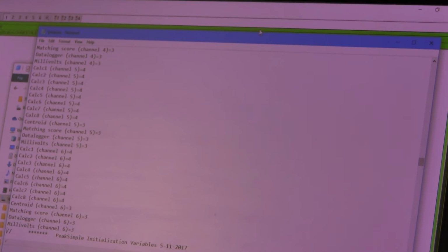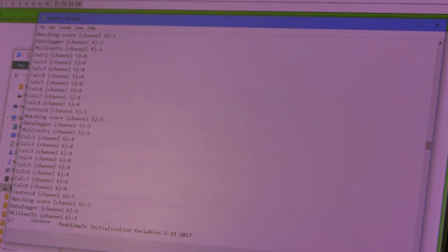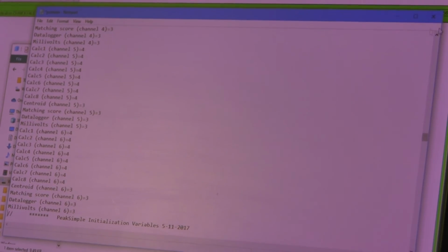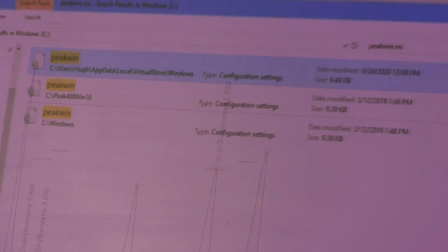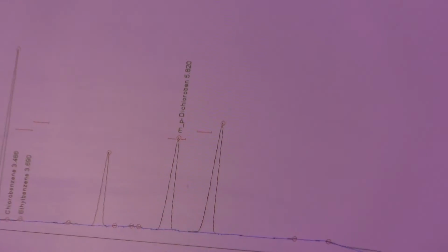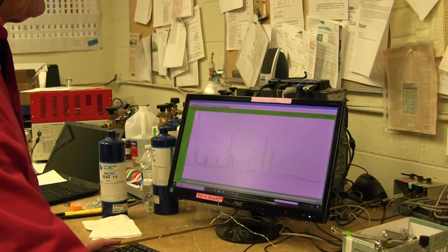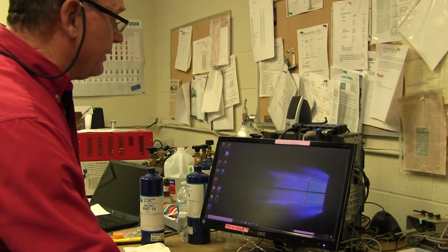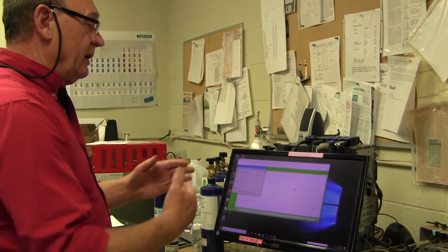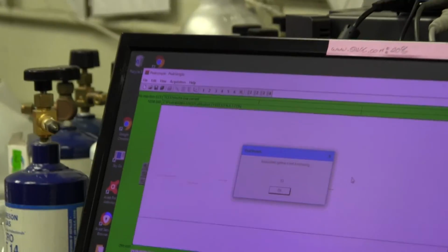This works better than just trying to copy the file, because Windows, if it doesn't like you, it won't let you copy the file. But this way we trick Windows by copying the contents of the file, and at that point everything's happy, and we should be able to now go and run PeakSimple software without any problems. But remember, you do have to close PeakSimple and then launch it again, because it only reads the INI file at the time that it launches, at the very beginning when you first launch it.